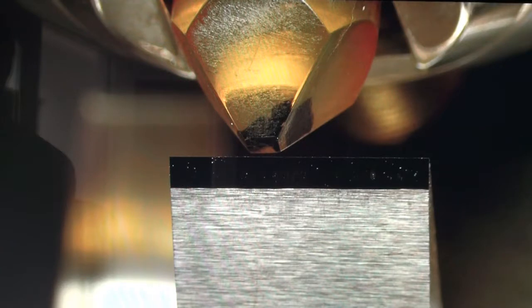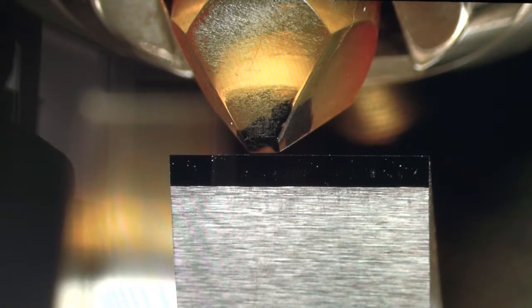So what we're going to do is adjust my specimen rotation for my leading edge. It's not real critical at this point since we're just facing off, but it's always good to be as accurate as possible.